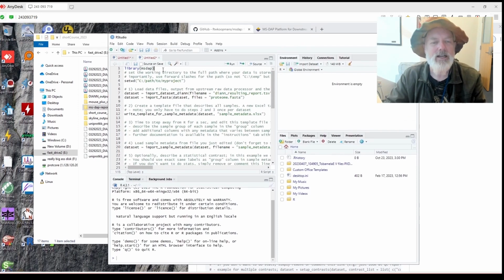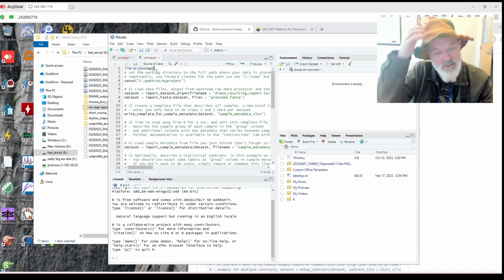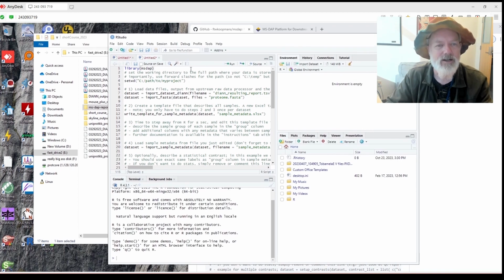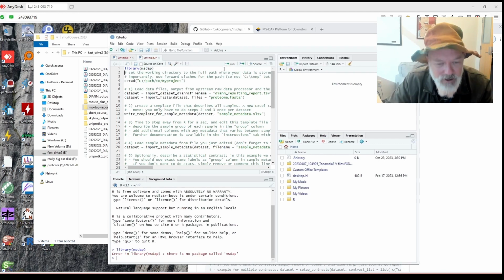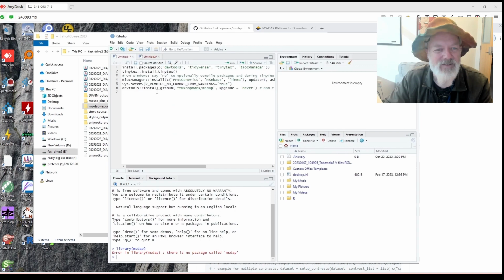And so the first thing I like to do, especially if I haven't run it before, is run each line individually, and that way I can see if there's any problems. So first we'll try to load the library, MS DAP, and see if it installed correctly. That's an error. Okay, there's no package called MS DAP. Okay, so something happened. Let's see.